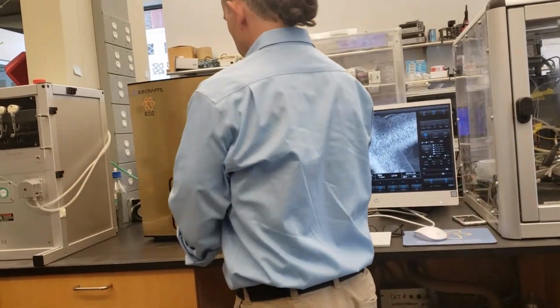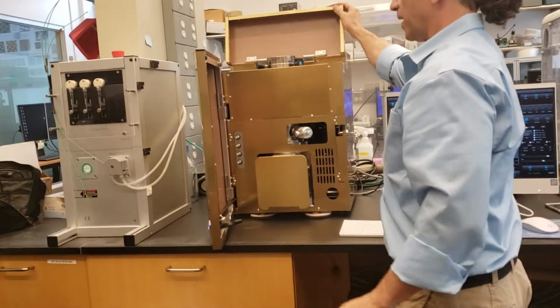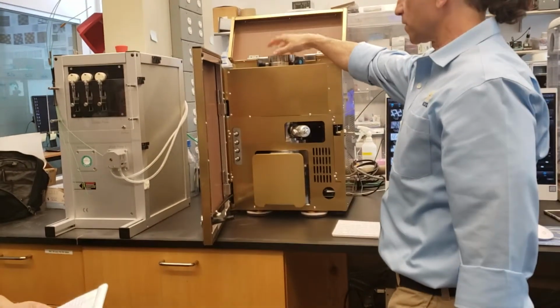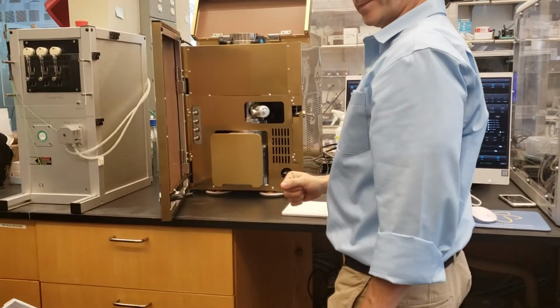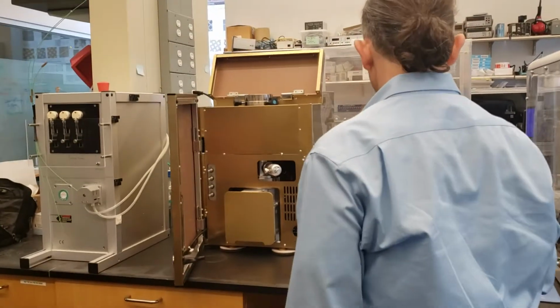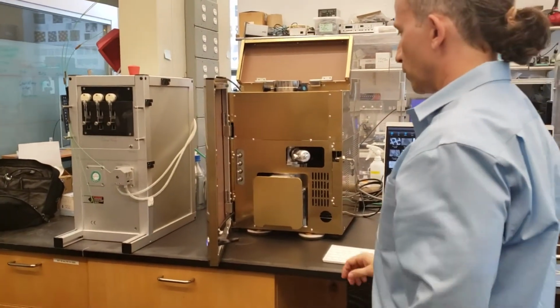This is just a door that opens and closes. Right? And this is another door up here that gives us access to the gun on the microscope. This is the gun, column, final aperture assembly, stage. So pretty straightforward. I'm telling this to open up the stage door for us.